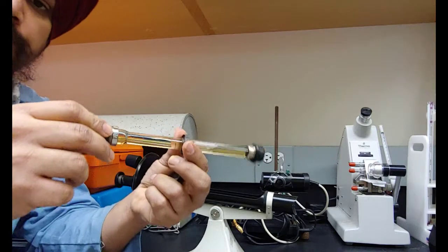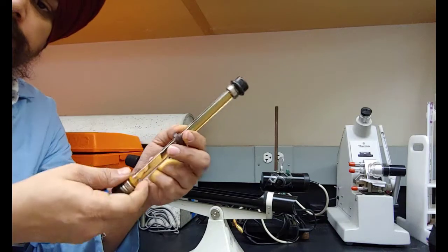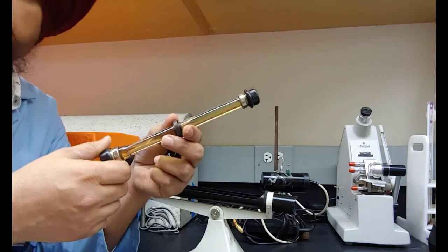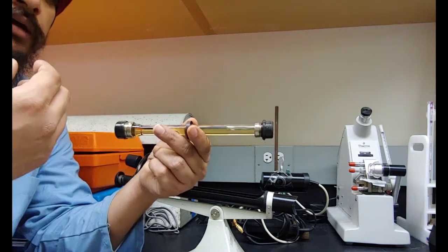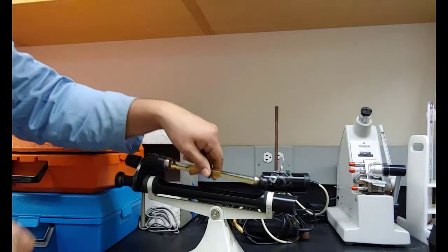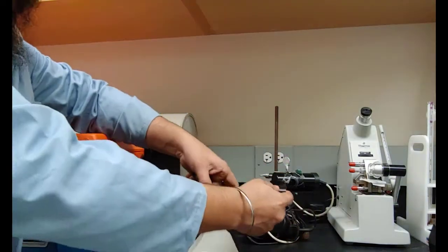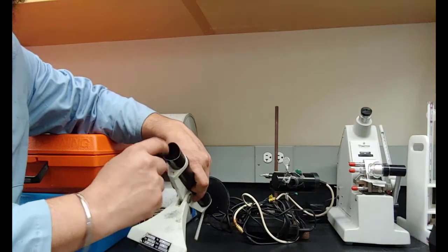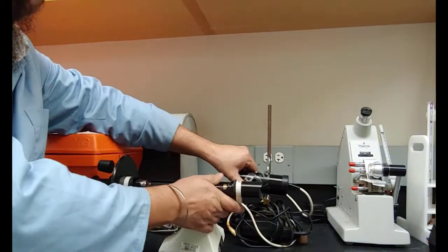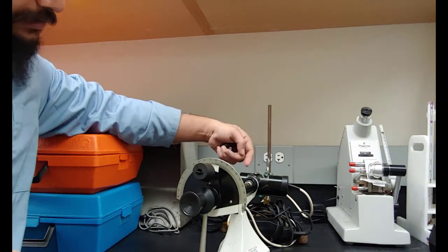So in the glass tube you can fill your molecule. If your molecule is liquid, such as any oil, you can fill it up. If it's a solid such as sugar or glucose, you can make aqueous solution and then fill this tube up. And then you put this tube in here, and on this end, it's hollow, and there's a polarizer on this side, and that's a light source. This one is a bulb, so this side gets connected here, and the bulb shines a light from this side.